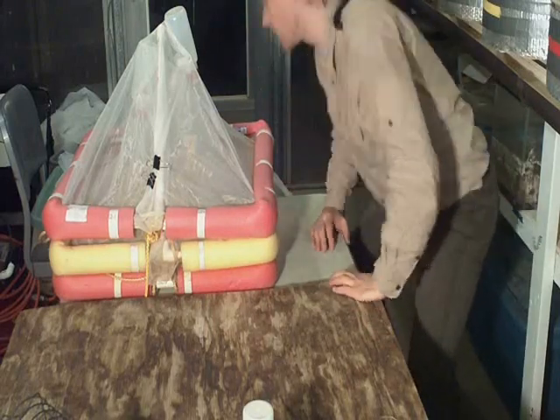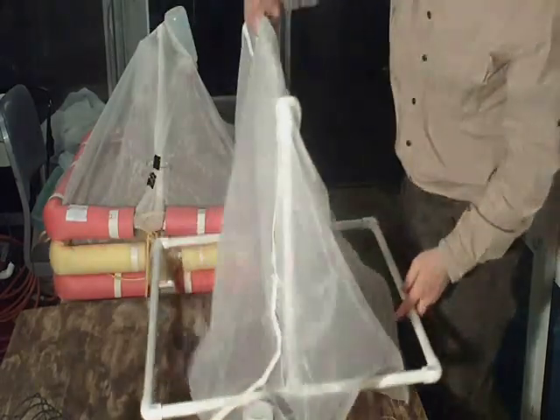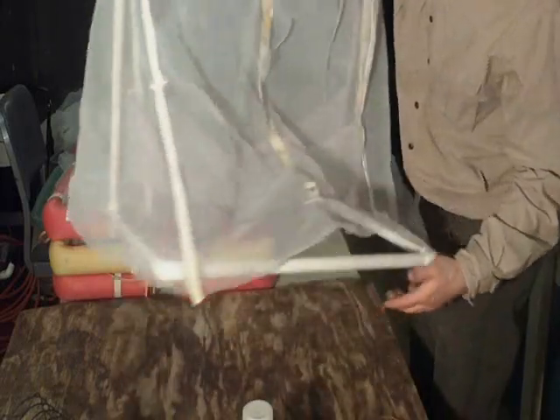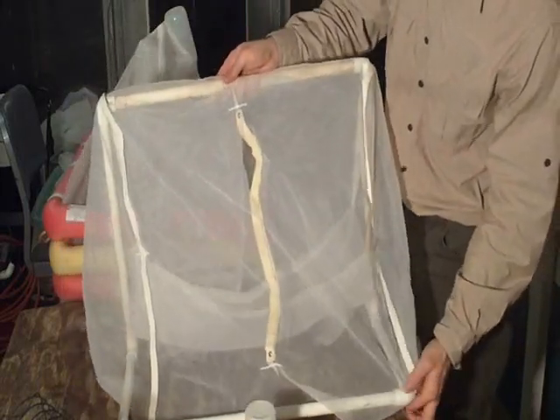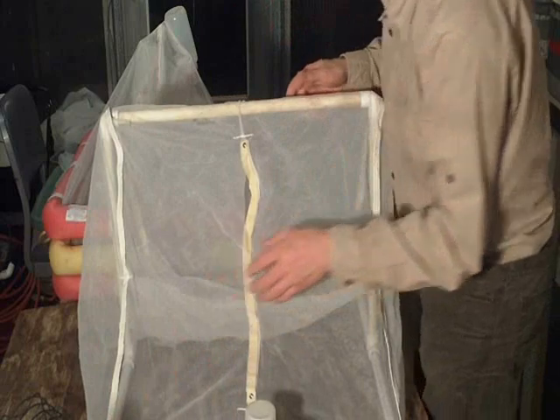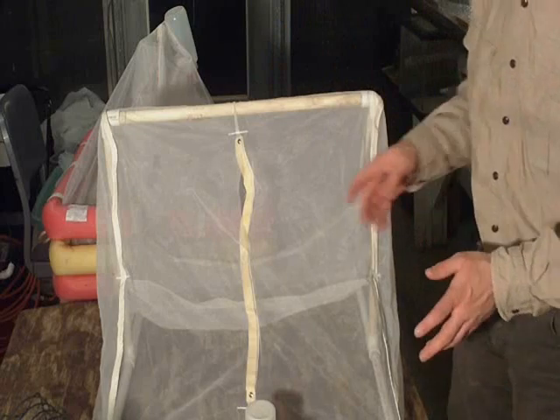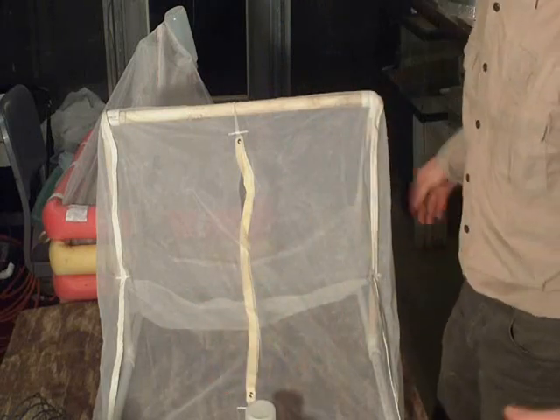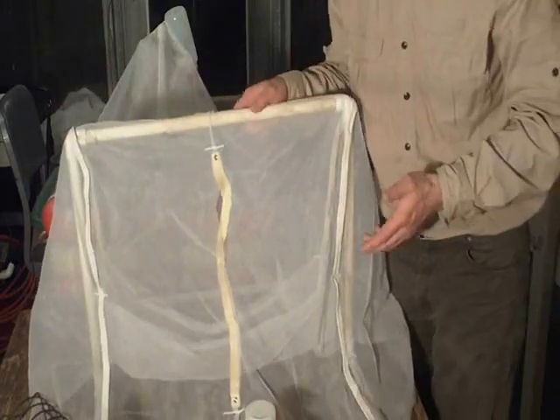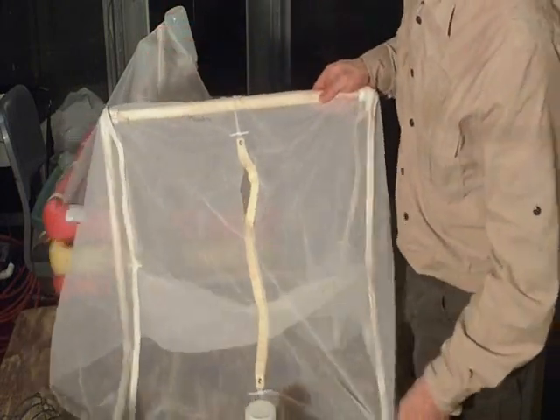So just real quick, it's a small greenhouse, so my head's going to be cropped up. I apologize. This one here is from Dr. Kurt Fausch. It's identical to the one that Colden Baxter used, and it's a really nice setup. So they aspirated. I decided not to aspirate. I totally trust their ability to aspirate, but if I was finding it was taking me 10 minutes and I was dropping organisms in the stream, and if I used the boogie board technique where I put a boogie board underneath it and then moved it to the bank, I was worried about getting organisms that had emerged elsewhere and were just hanging out on the bank.